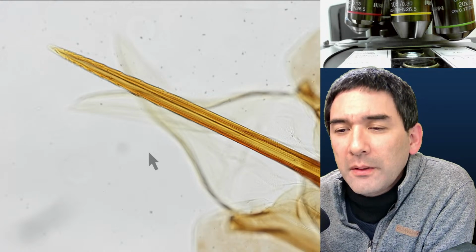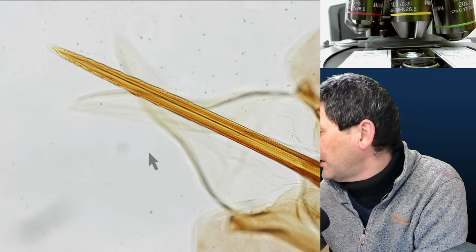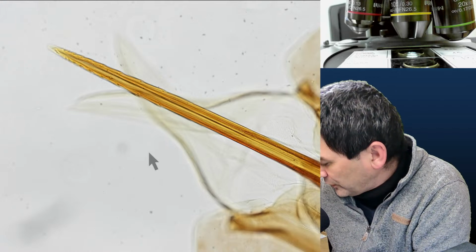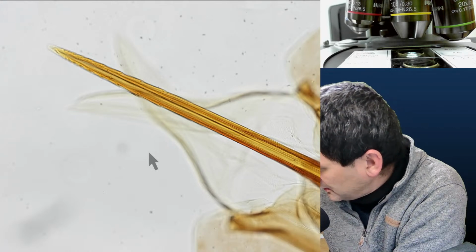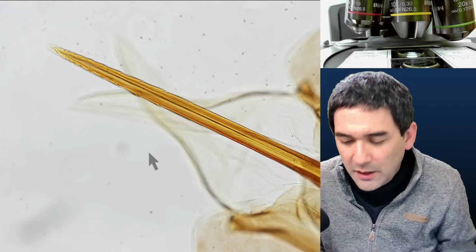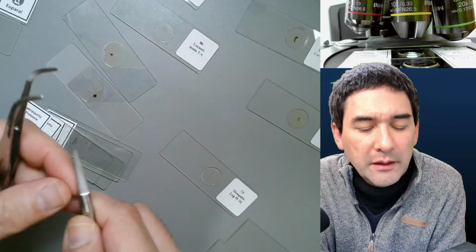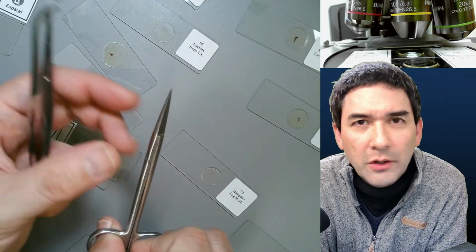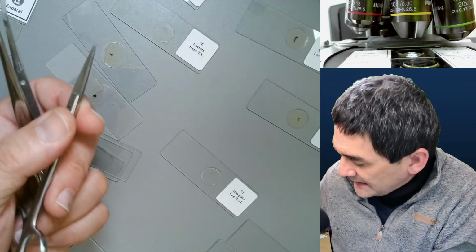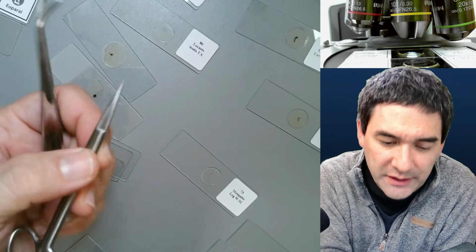Last question here. How do you dissect specimens? Any special equipment? I can actually show you what I recommend. It's quite simple. The most important tools for dissection are... that's essentially what I've used here. Very fine scissors, not a knife. Some people think of a scalpel, like the doctor uses. I don't consider them very useful because then you have to apply pressure.